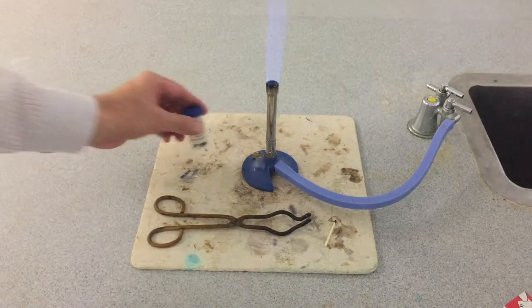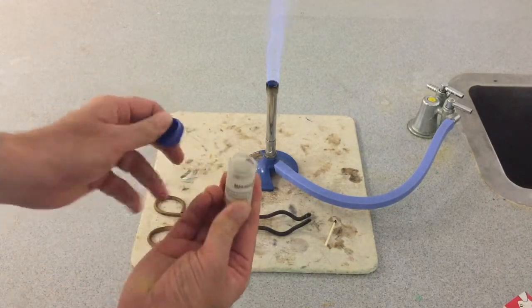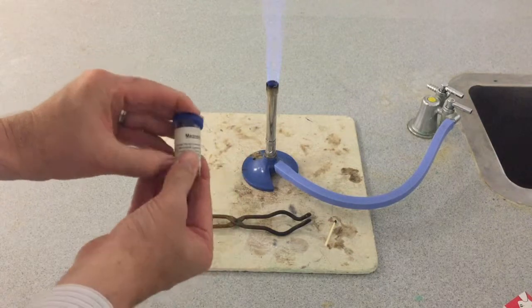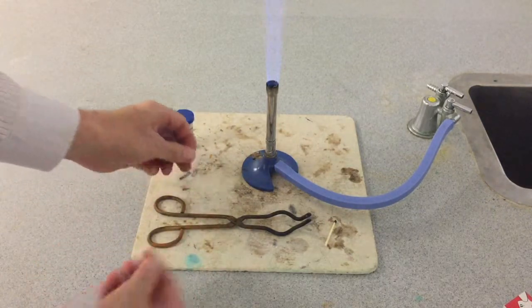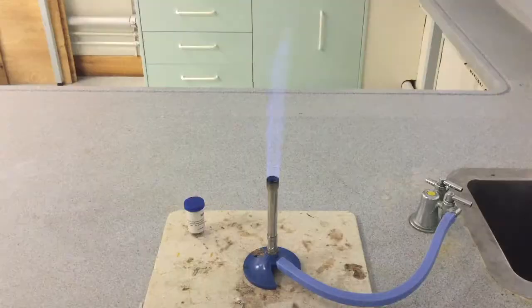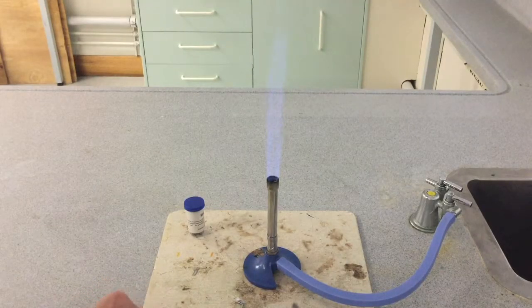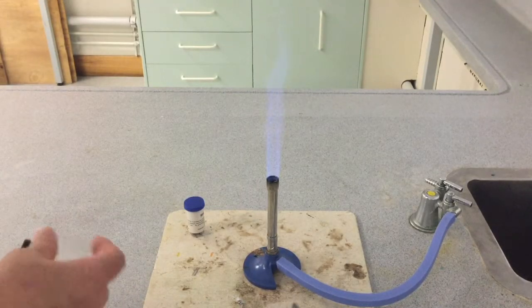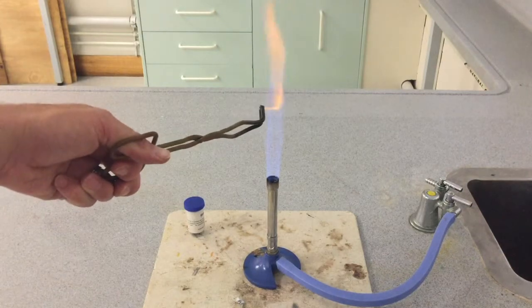Next, take out a piece of magnesium from the vial containing the magnesium ribbon. Once we have a piece, we use the metal tongs provided. The teacher will hold the magnesium and place it into the Bunsen flame so we can observe what happens to the piece of metal.